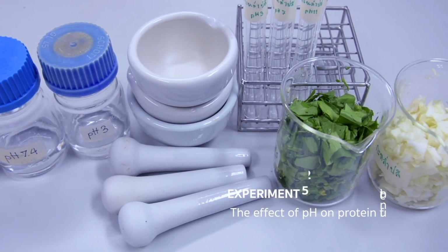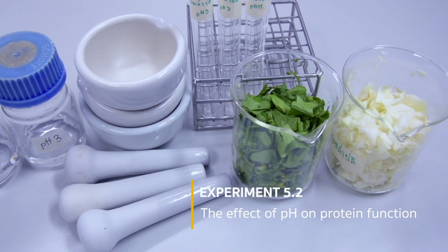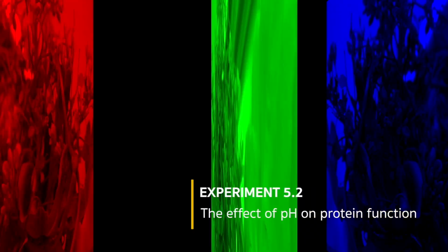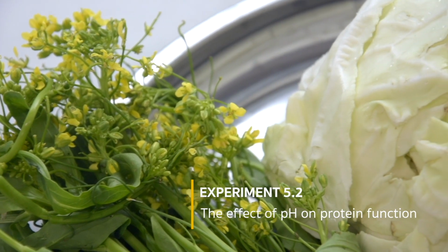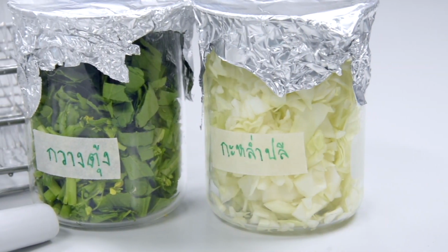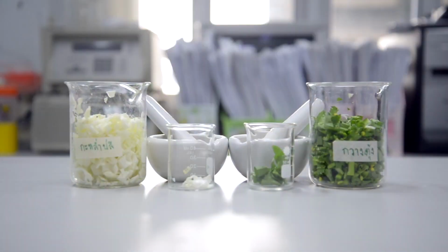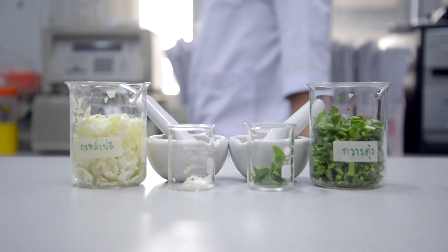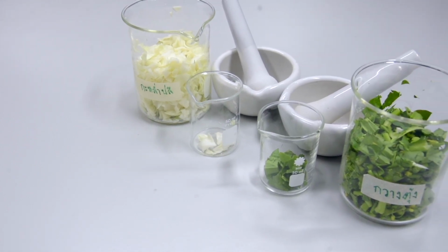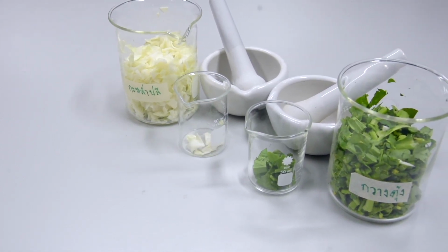Experiment 5.2: The effects of pH on protein function. Catalase is a common enzyme that can be found in many plants. This experiment studies the efficiency of catalase activities of Chinese cabbage and cabbage extracts at different pH conditions.